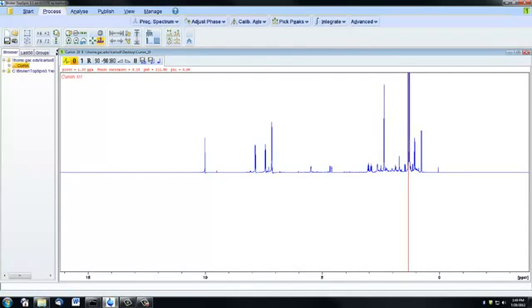And once it looks pretty straight, you can move on to the first order correction, which is going to even out the baseline to the far left of the red line. So you'll see if I move it now, the spectrum is changing on the left side of the screen. So again, you're going to want to try to level out your baseline.